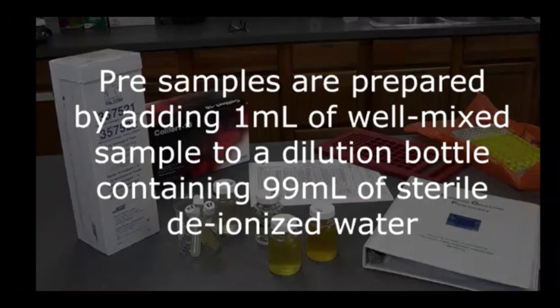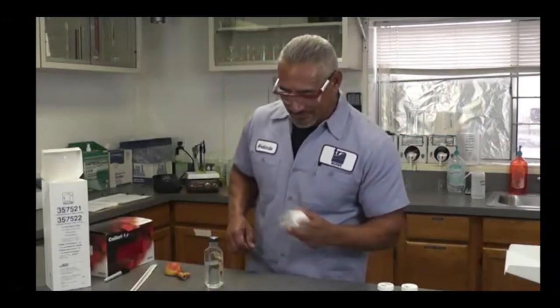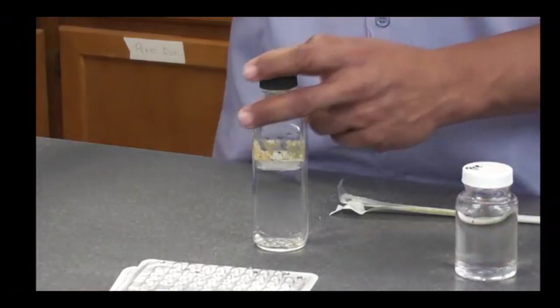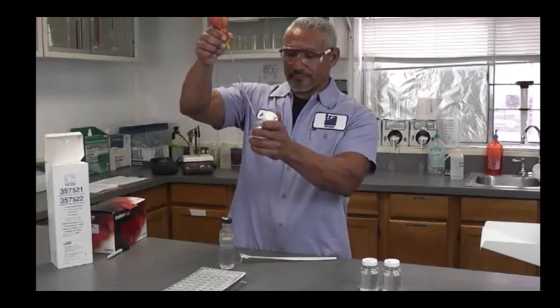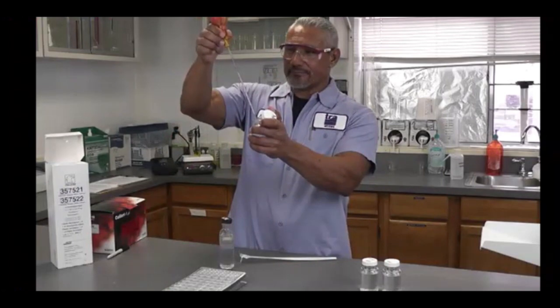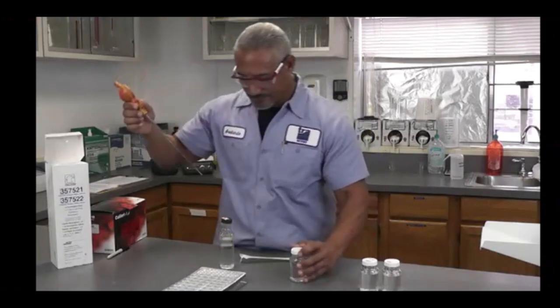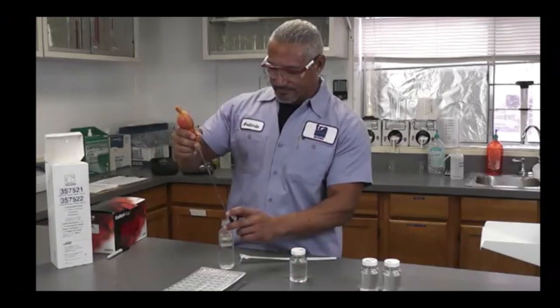Pre-samples are usually prepared by adding 1 milliliter of well-mixed sample to a dilution bottle containing 99 milliliters of sterile deionized water. Shake the sample vigorously to resuspend the bacteria. Loosen the caps on the sample bottle and dilution bottle. Use a sterile pipette to transfer 1 milliliter of well-mixed sample into a dilution bottle containing 99 milliliters of sterile deionized water. Use aseptic technique for the transfer.